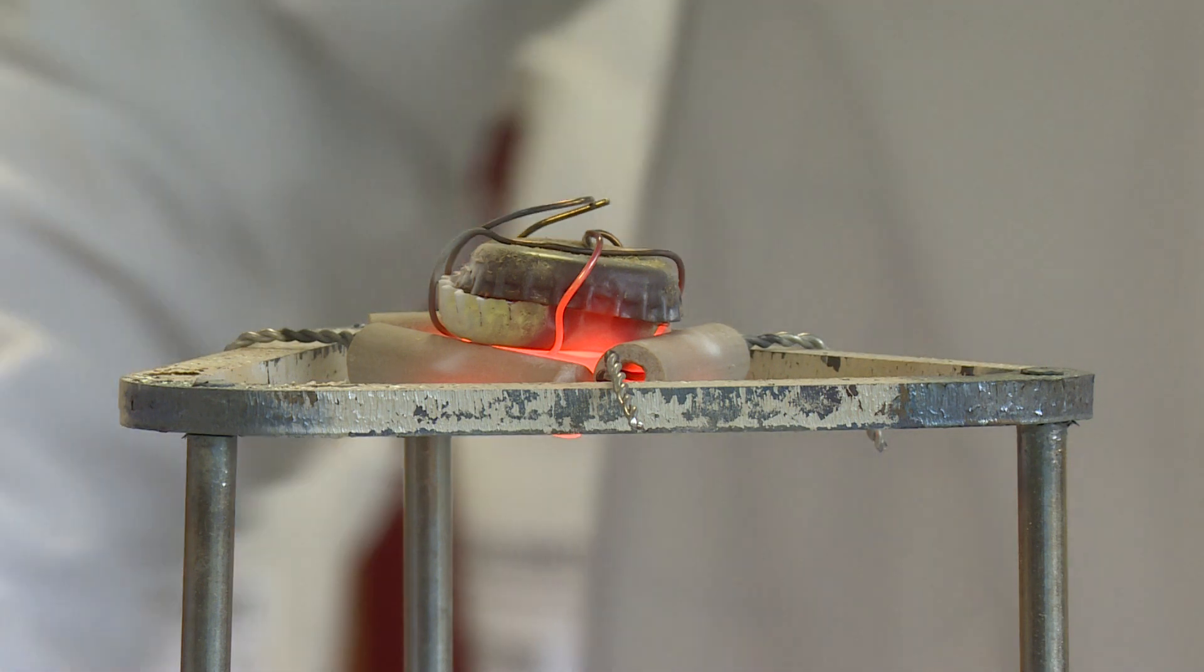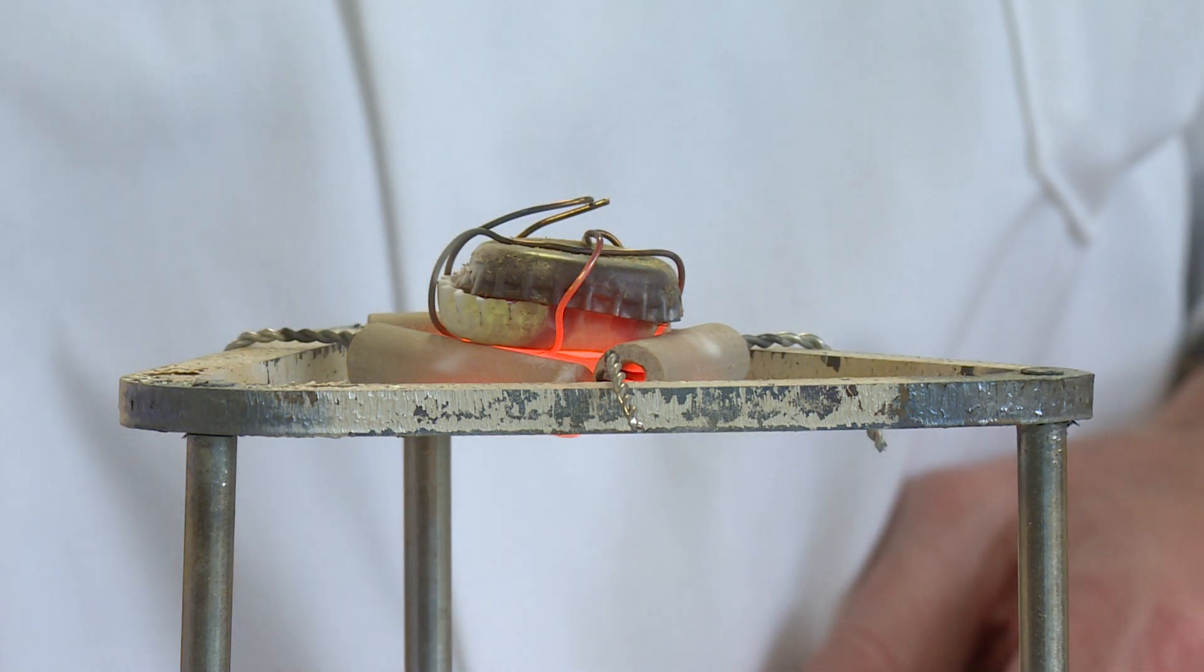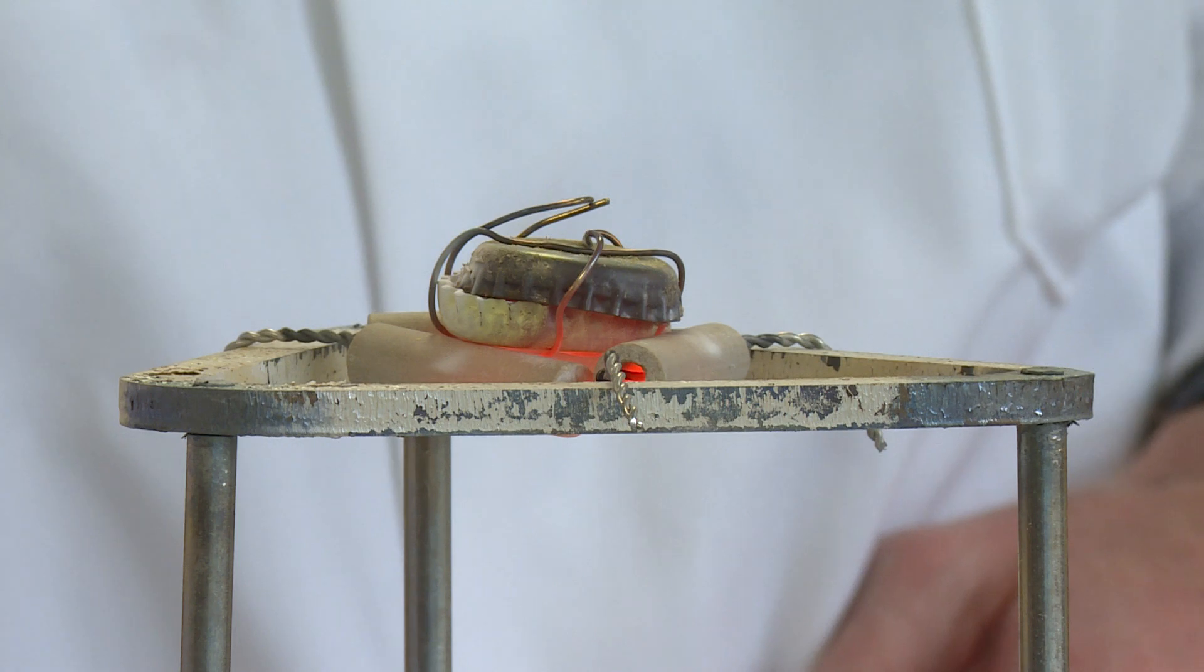So we'll now turn the Bunsen burner off and allow that to cool for a few minutes.